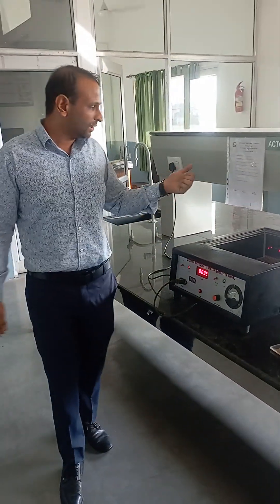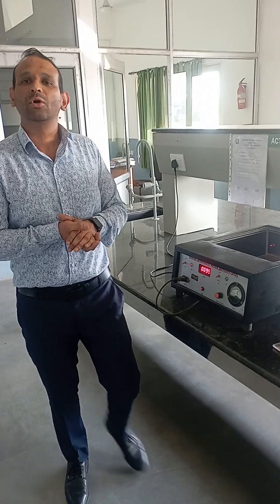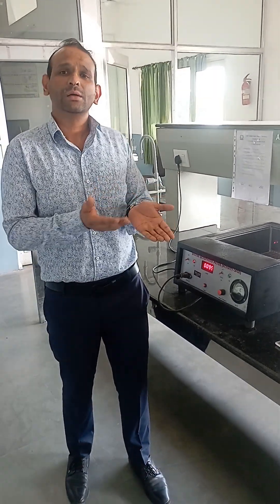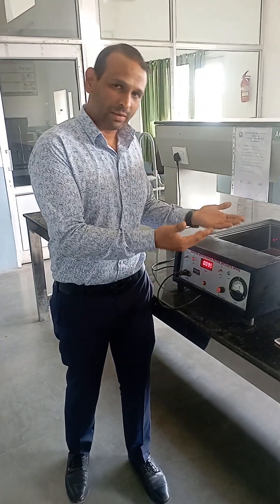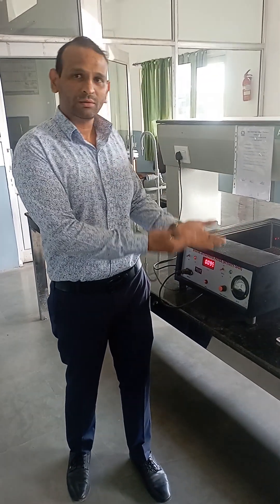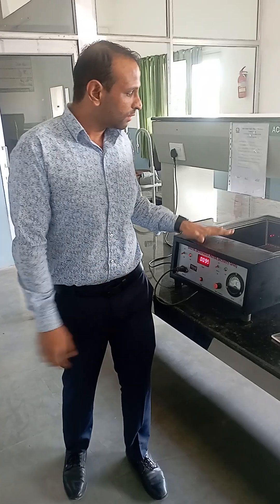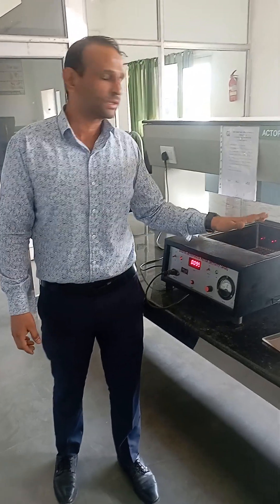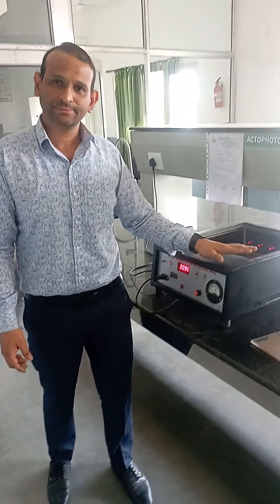Finally, we calculate the percentage decrease in locomotor activity — representing anti-anxiety activity — using the formula: (control crossings minus test crossings) divided by control crossings, multiplied by 100. This is how we perform the experiment on the actophotometer apparatus. Thank you very much.